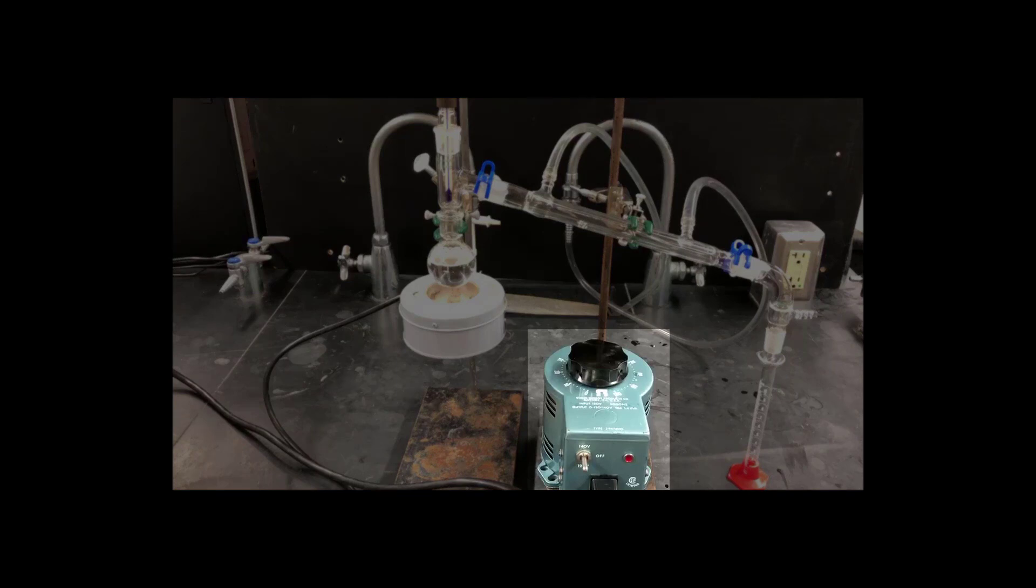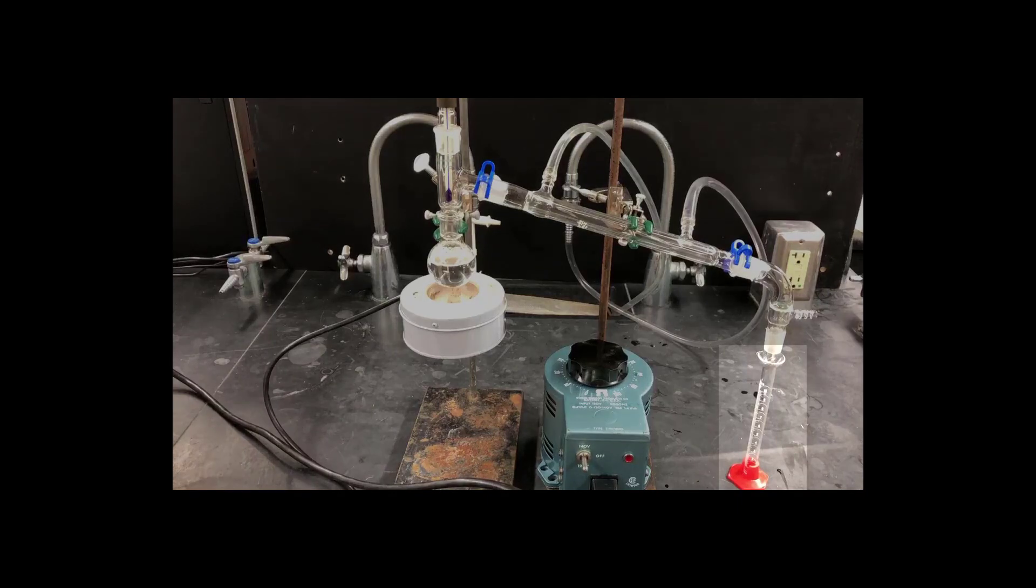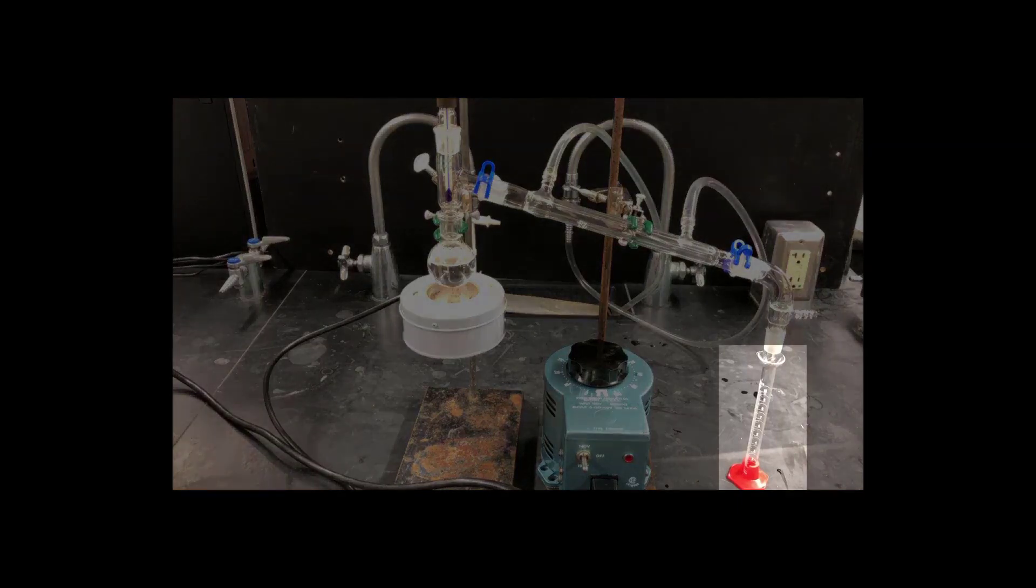Don't plug it directly into the wall current. It will get too hot. The only other difference is I'm using a graduated cylinder as a collection vessel, instead of a round bottom flask. But again, this change won't make any difference in the course of the distillation.